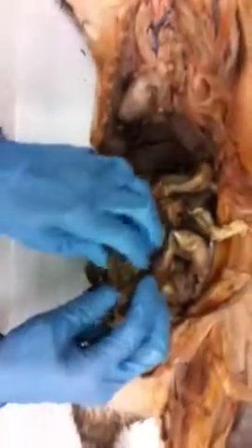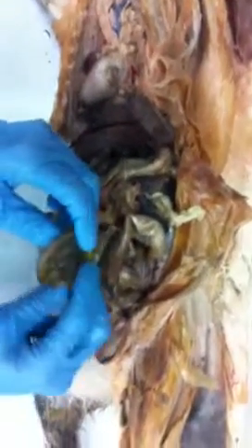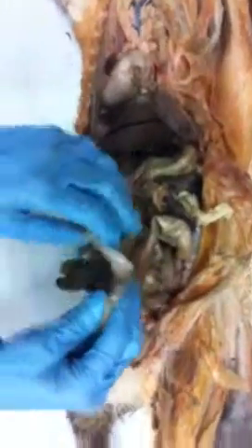So you only lost 12 inches. That's not bad. But it wasn't obstructed. Yet. Right. That would have been really bad.